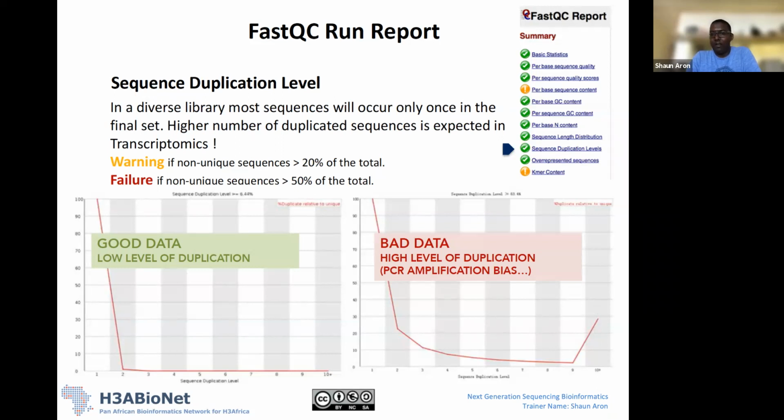Okay, so again, this is indicating that there could have been something going on. There were certain fragments that we amplified multiple times, exact fragments that we amplified multiple times. So again, this can be used to look at the quality of your sequence data, and also the quality of your PCR amplification, your library preparation as well. Okay, so essentially the bottom line is we don't want to see a significant amount of duplication of sequences in our data set.